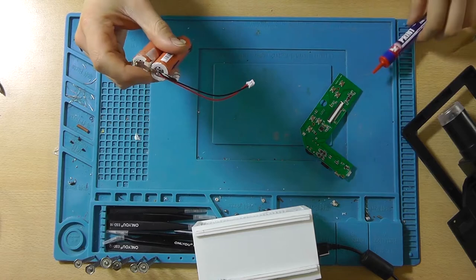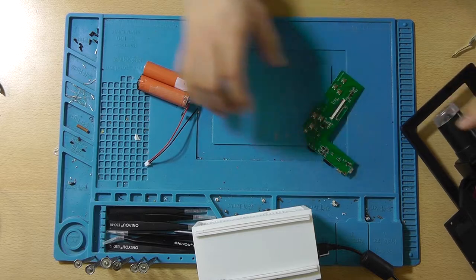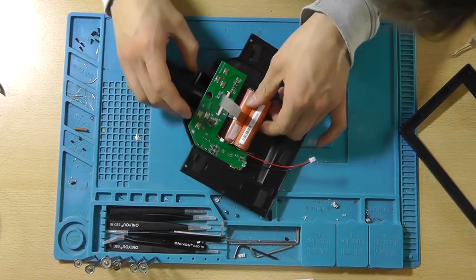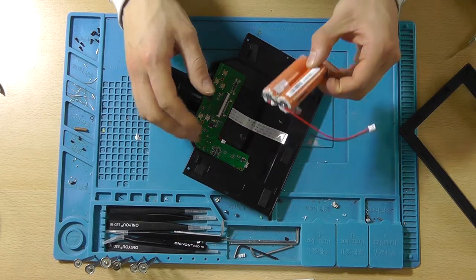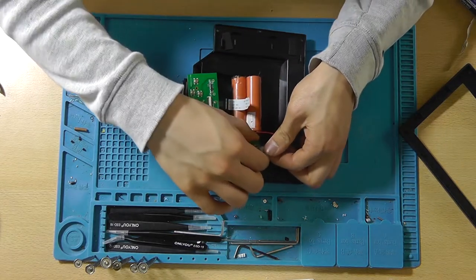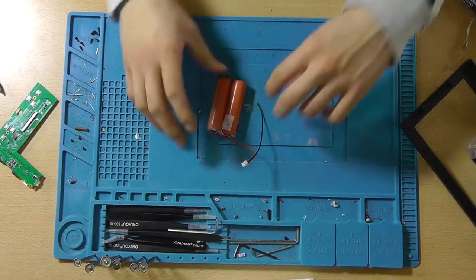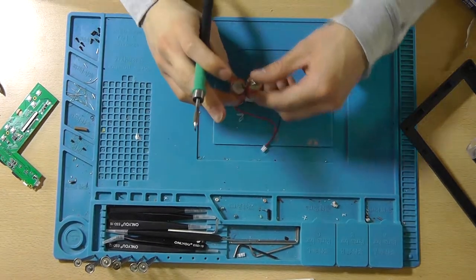So one side is soldered on. Now let's actually try to see if we can fit it all in here. Should go something like this. Maybe we'll swap it around. That's working. That's fitting how I want it to fit. So let's solder the negative connection in place and we'll install it.